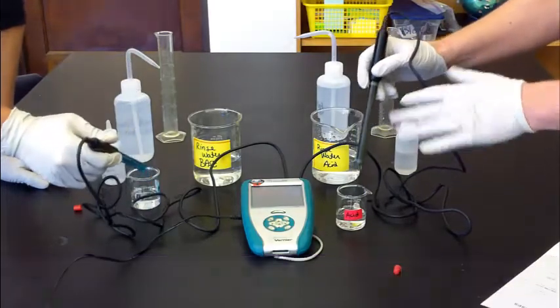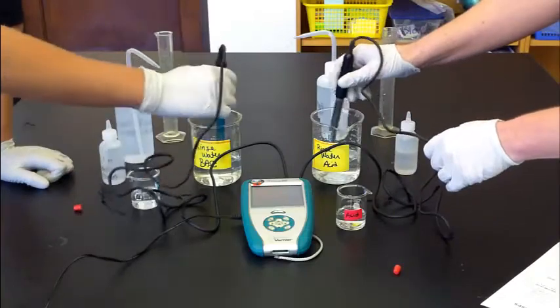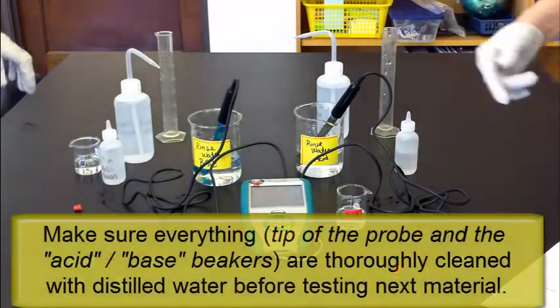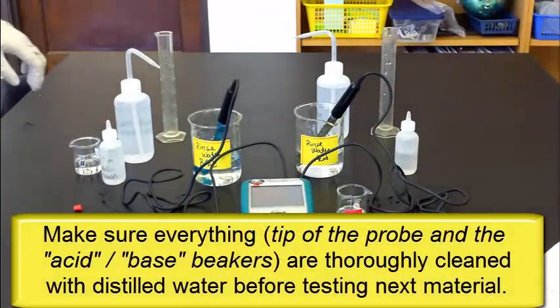When you're finished with that solution, you'll put it back into the rinse water, let it sit there, you'll clean up, and you'll move on to your next substance. Same procedure.